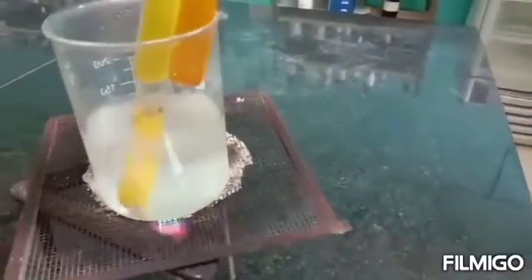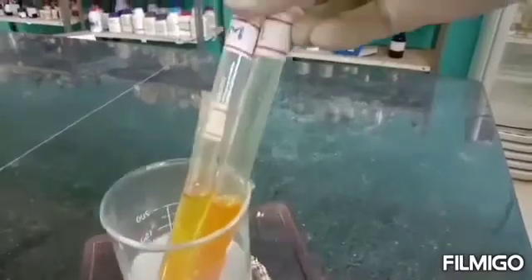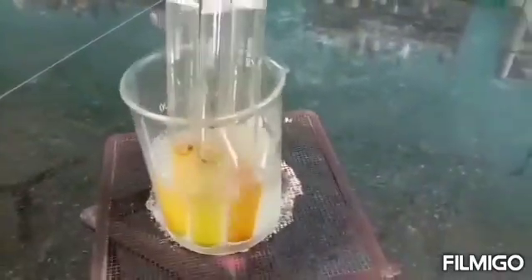Maltose and lactose will take more time — 30 to 40 minutes we have to keep them. Now glucose is taken out and kept in cold water; it is properly cooled.